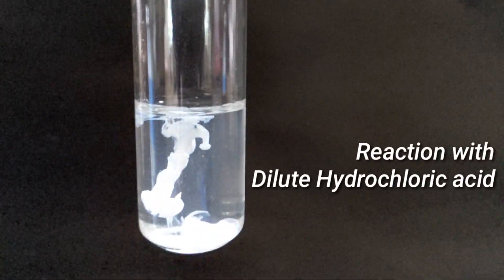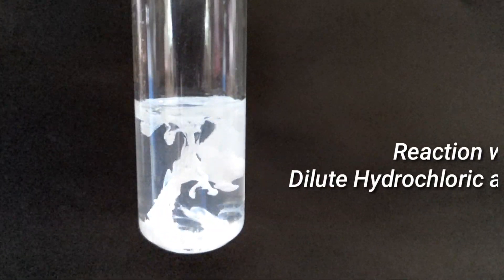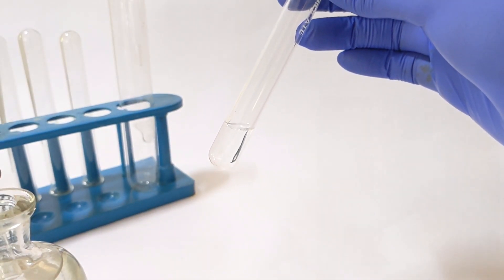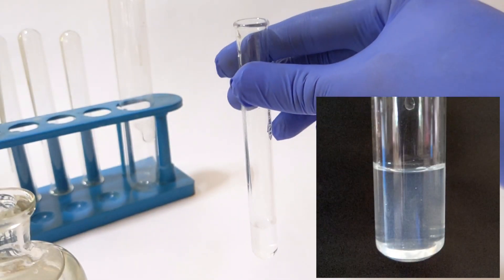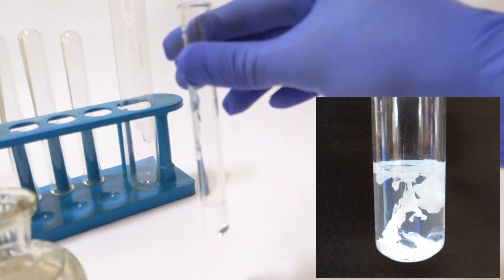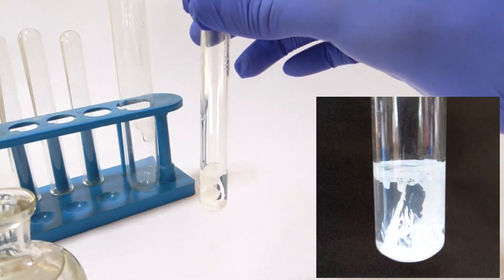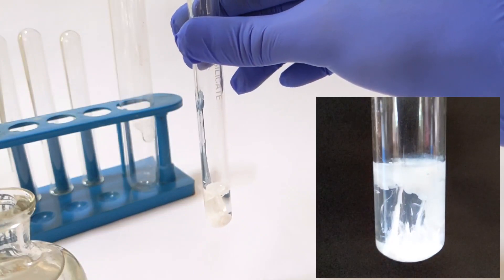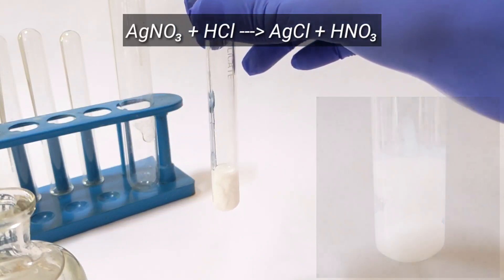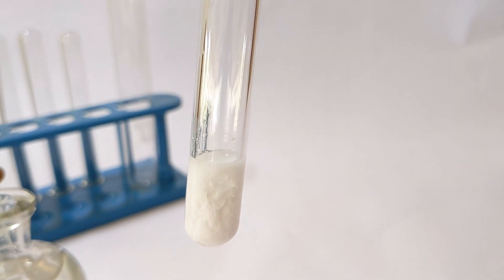First we see the reaction with dilute hydrochloric acid, that is around 3 molar hydrochloric acid. In the test tube I have taken 3 milliliters of the N/10 solution of silver nitrate. Into that was added few drops of dilute 3 molar or even 2 molar hydrochloric acid. Immediately you see the development of a thick white precipitate which many Indian textbooks refer to as curd-like or yogurt-like consistency. It is so dense that it quickly settles down to the bottom of the test tube.